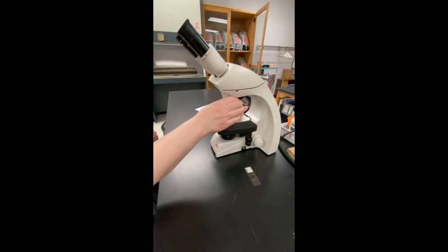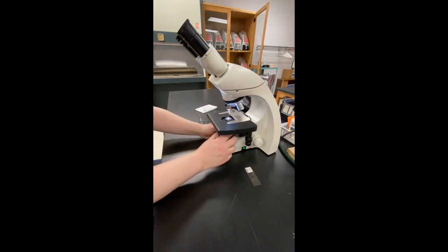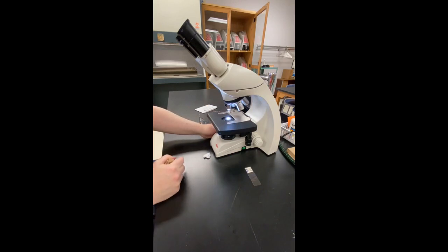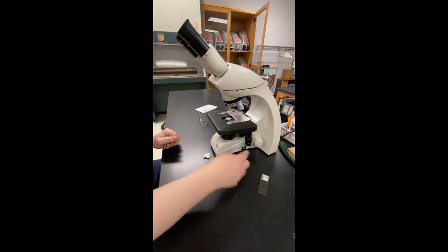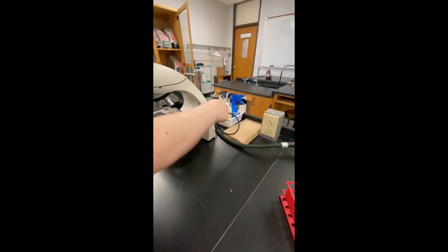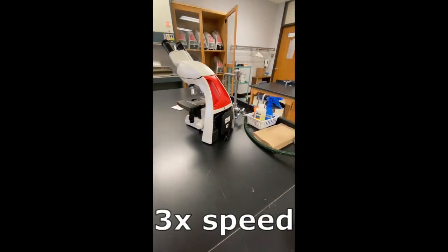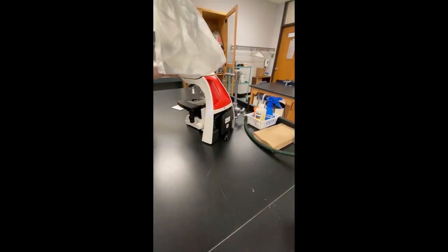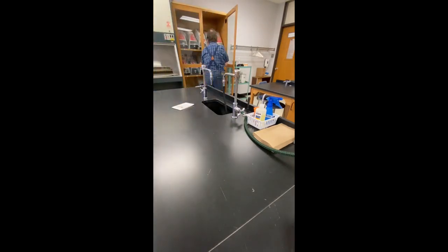To finish up, put the scanning lens into position. Open the diaphragm, then turn the light control all the way down. Check that the stage is all the way down. Then turn the power switch off. Remove the plug and wrap the cord. Put the cover back on, then return the microscope safely to the cabinet. Match the microscope number with the location in the cabinet.